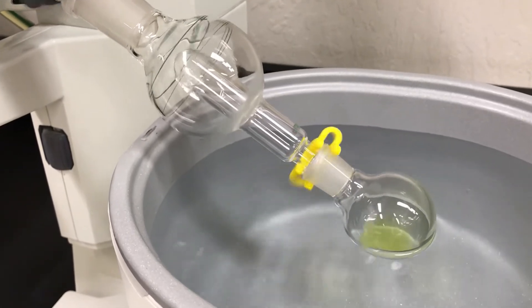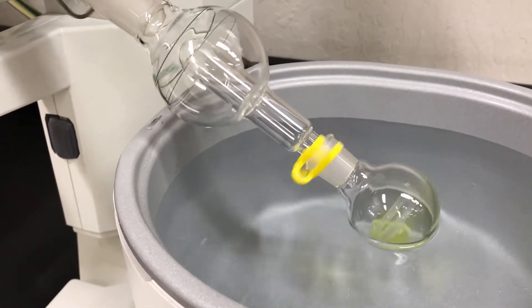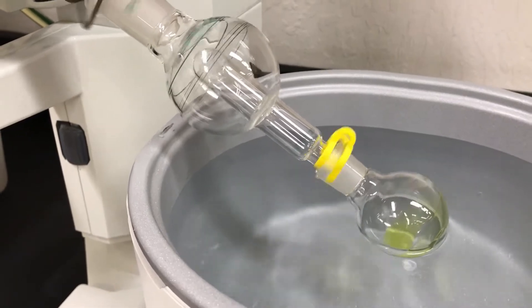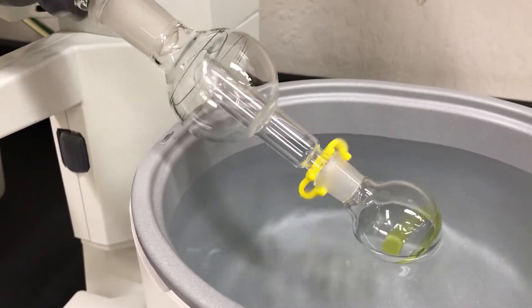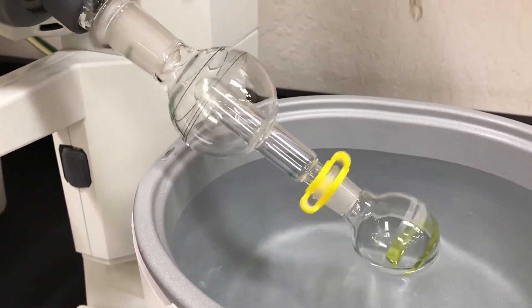If you're expecting a liquid that's much more difficult. You just want to wait until the solvent level has dropped quite a bit and then you think it's not reducing anymore.